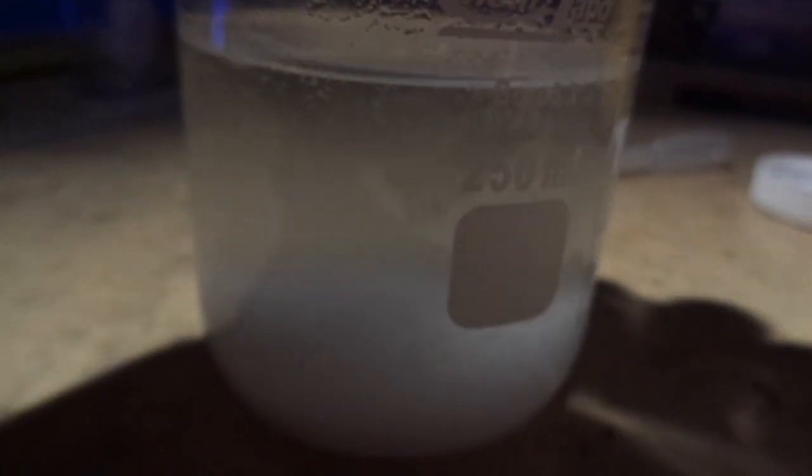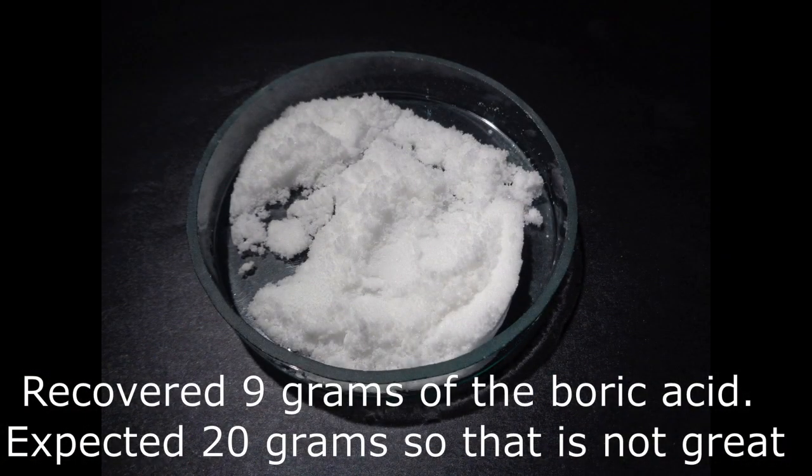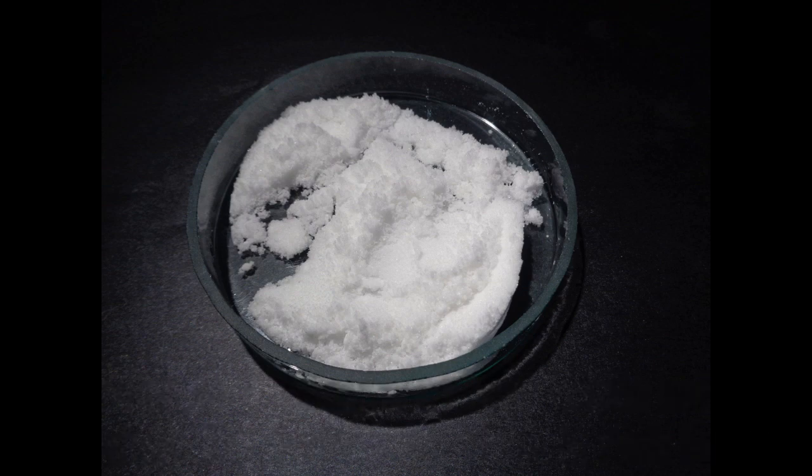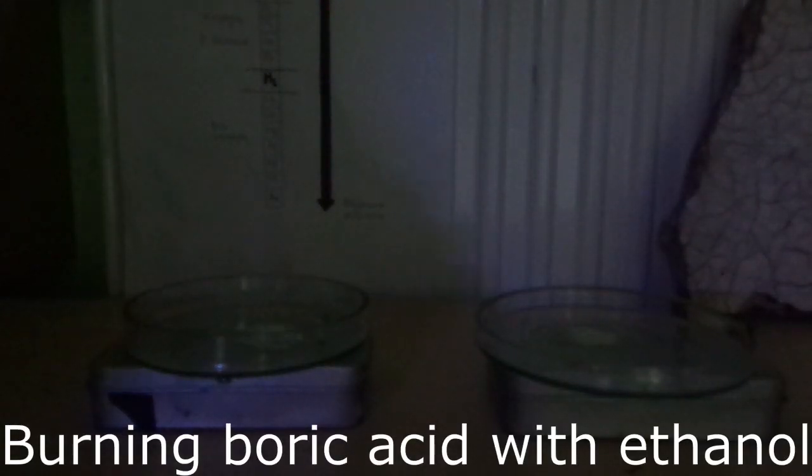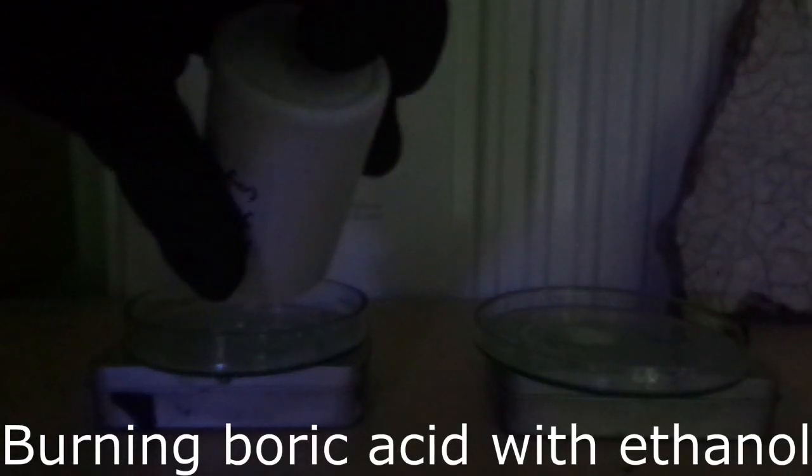This is all the boric acid that had precipitated out from the solution when I cooled it.